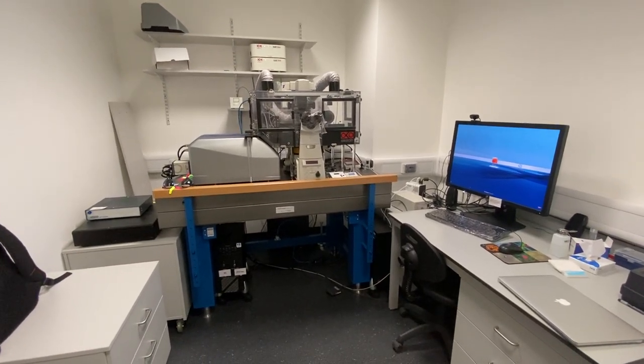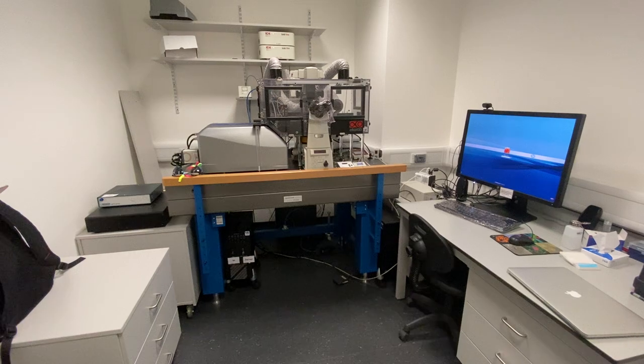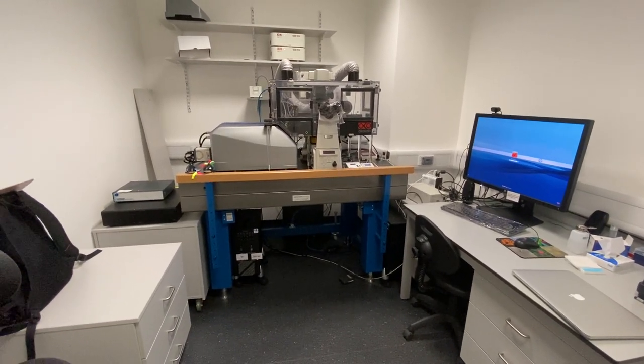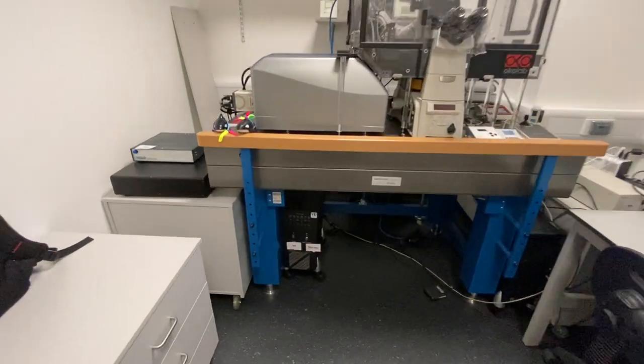This is a training video for the Nikon iSIM. When you first come into the room, you want to switch the system on according to the numbers.